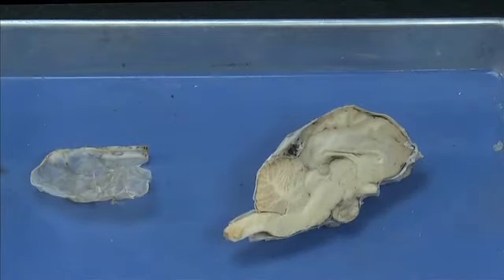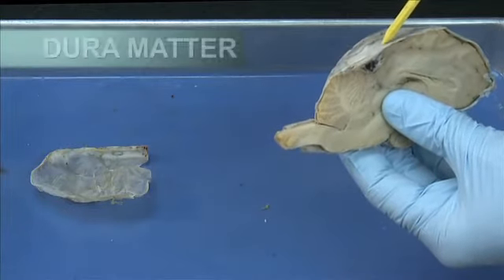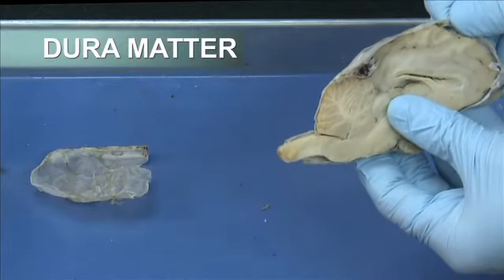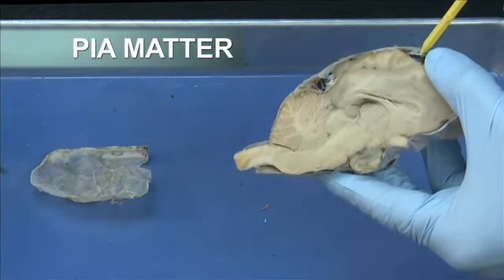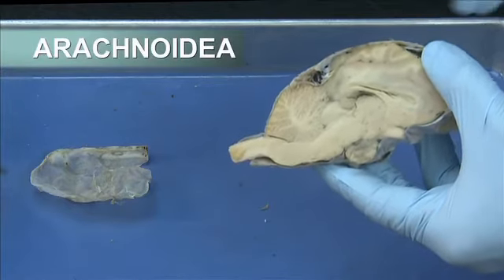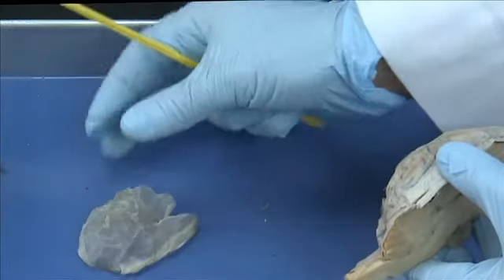The brain is covered with 3 membranes. I'm now pointing to the thickest membrane, which is the dura mater. Usually this membrane is removed with dissection of the brain when you extract the brain from the skull. Underneath the dura mater is the pia mater, and between the pia mater and dura mater is the arachnoidea. When you remove the dura mater, it looks like this.